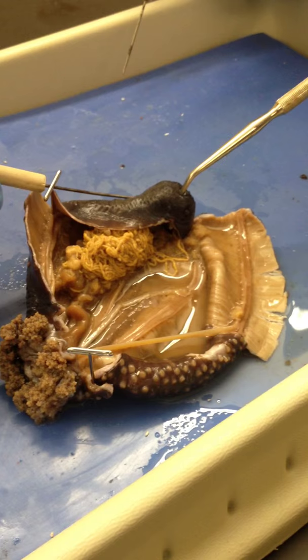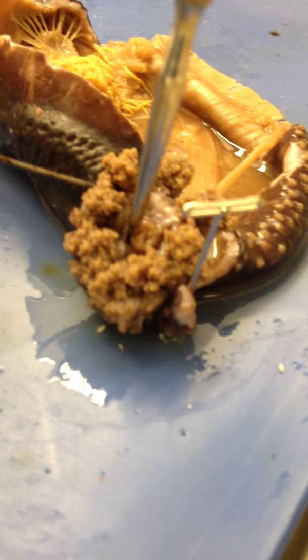Alright, so the anus. I am probing the anus right now. And this right here is the mouth. Let me see that mouth hole. I can't even see it. I'm inside of it.